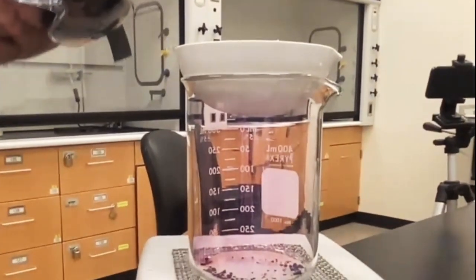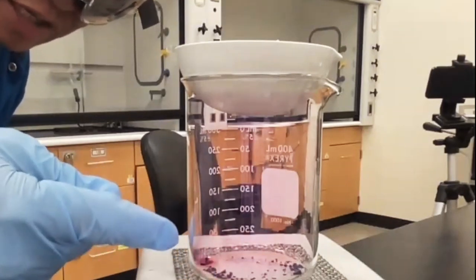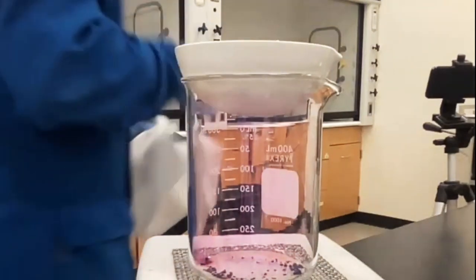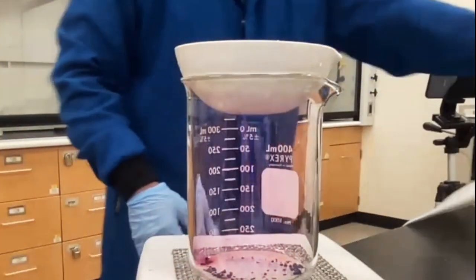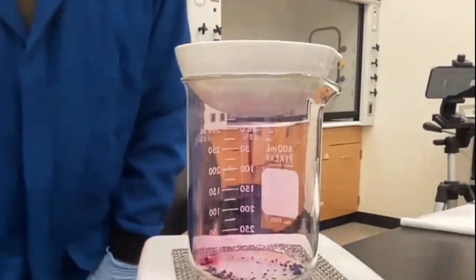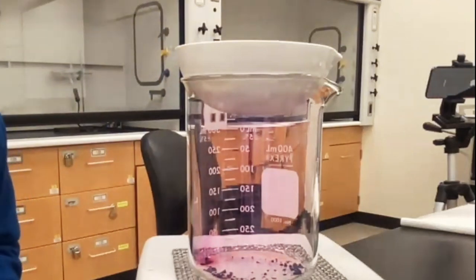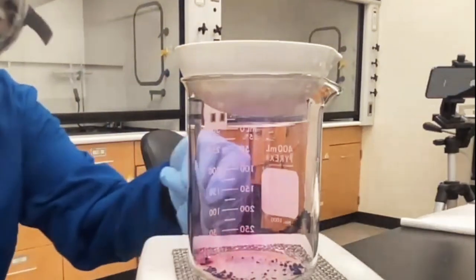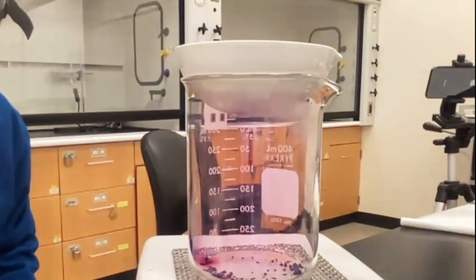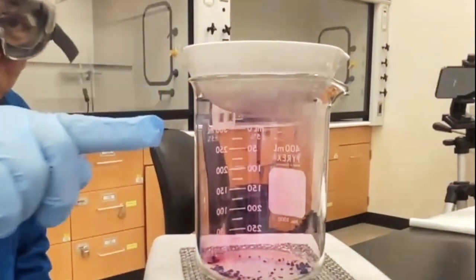Okay, you can see that there's a chemical here that actually is turning to a vapor, whereas the other chemicals are not. So that's important in your observation because the chemical that's turning into vapor, you need to identify that. Is it the cobalt chloride? Is it the sand? Is it the iodine? And you can see the gas that starts to form. That's what's going to be collecting in the cold surface.